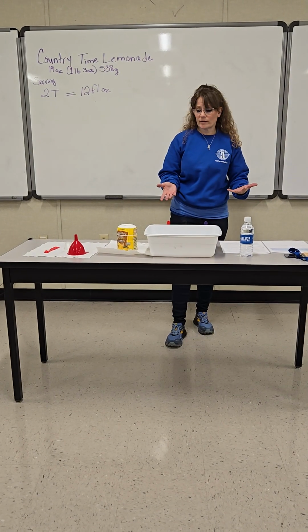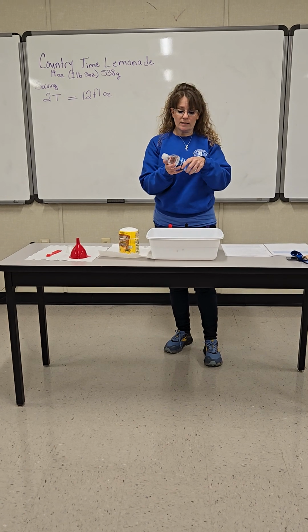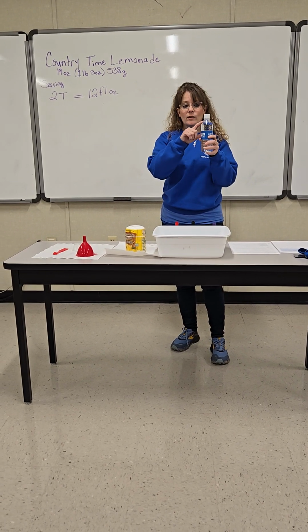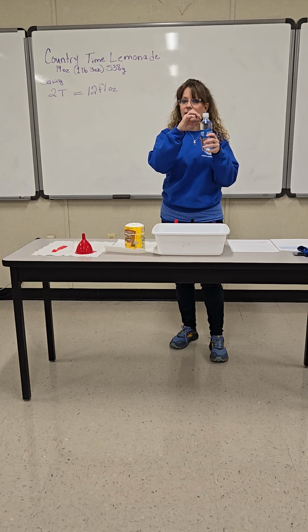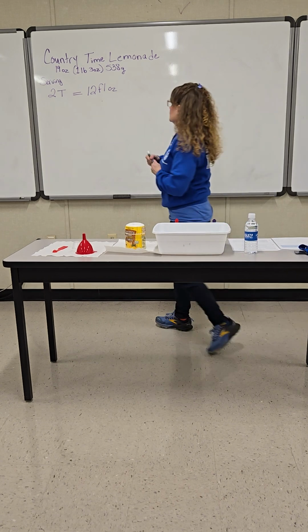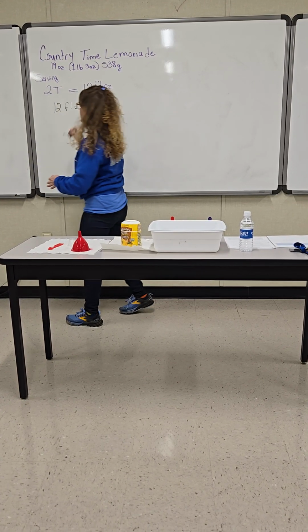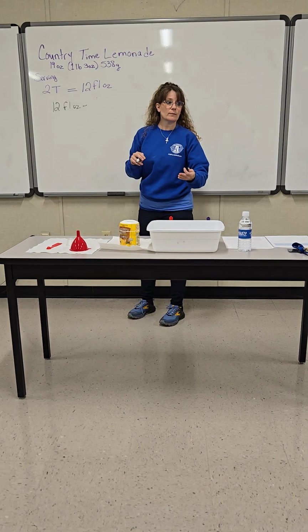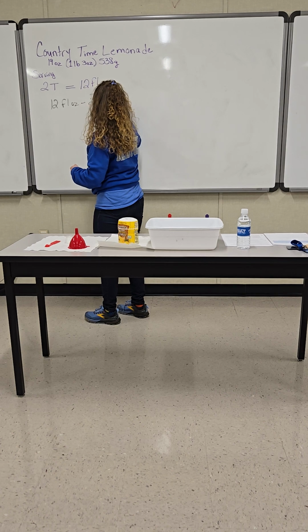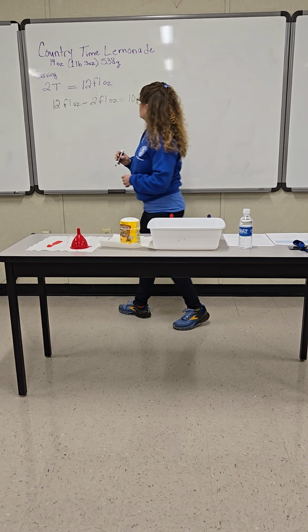Okay, so let's start part 2 of the Reconstitution of non-injectables. So I got my bottled water, and my bottled water is 12 fluid ounces. So I'm going to start with that. However, you see it's filled up here. If I go to put anything in there, it's going to overflow. So I got to subtract 12 fluid ounces minus however many ounces I want to dump out. I'm going to dump out 2. I'm going to give myself enough room, so I'm going to have 10 fluid ounces to work with.